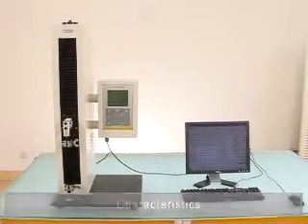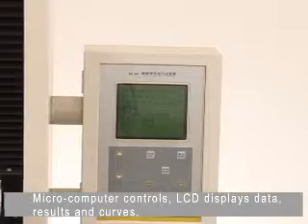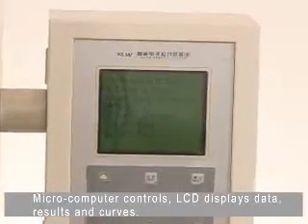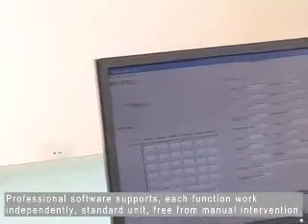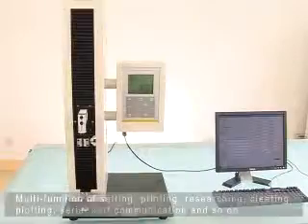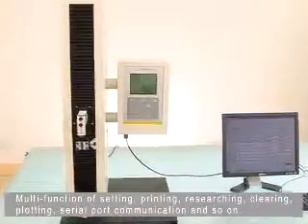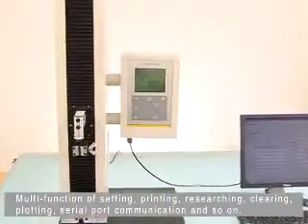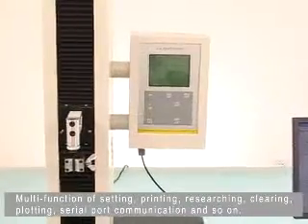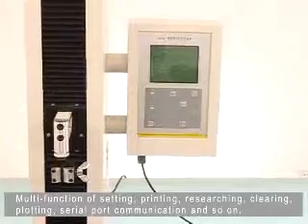Characteristics: Microcomputer controls LCD displays data, results, and curves. Professional software supports each function works independently. Standard unit, free from manual intervention. Multi-function of setting, printing, researching, clearing, plotting, and serial port communication.